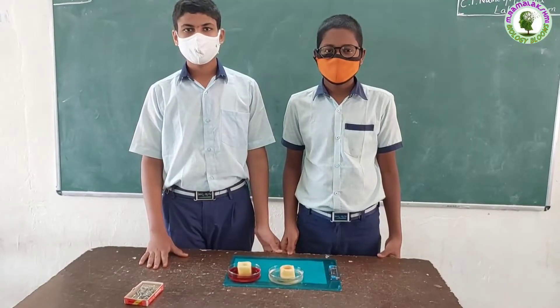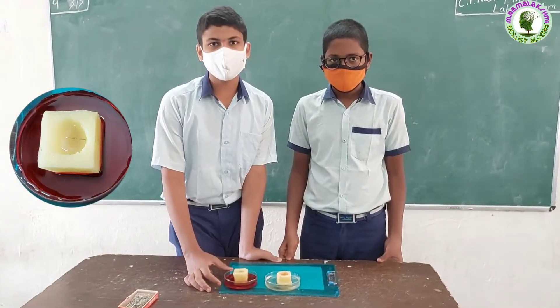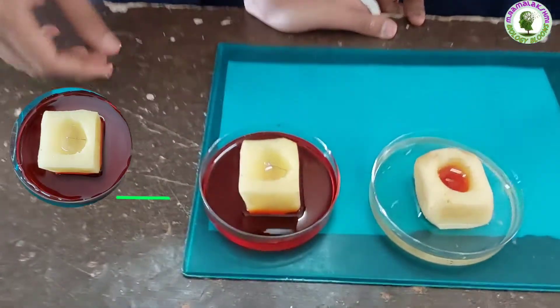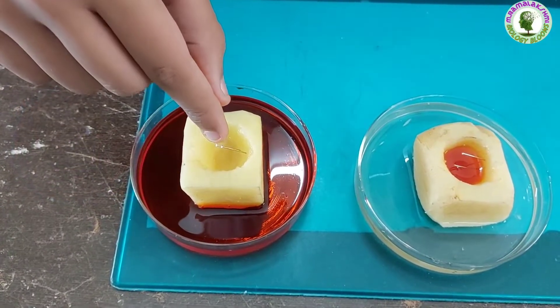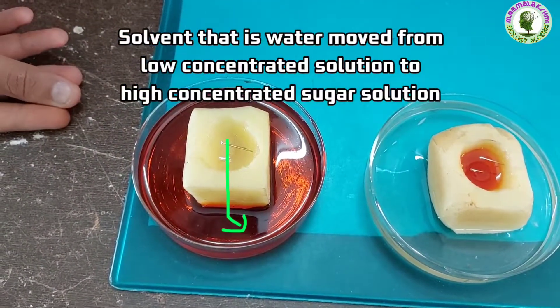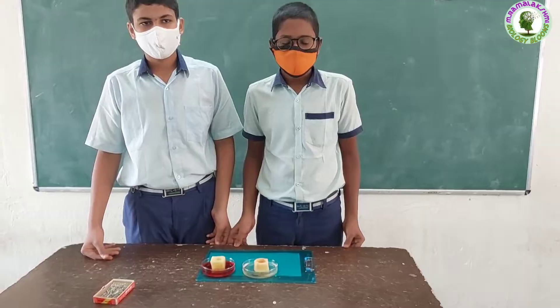Harish, what changes did you observe in the experiment? I took low concentrated water in the potato cup and high concentrated sugar solution in the petri dish. After half an hour, I noticed that the water level in the potato cup has decreased. Why, Harish? The solvent, that is water, moved from the low concentrated solution to the high concentrated sugar solution, ma'am.